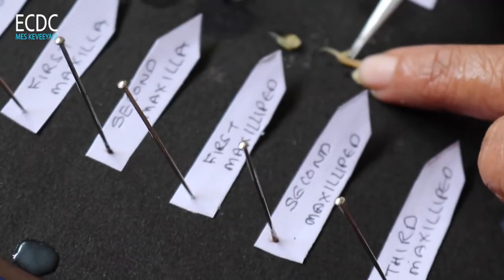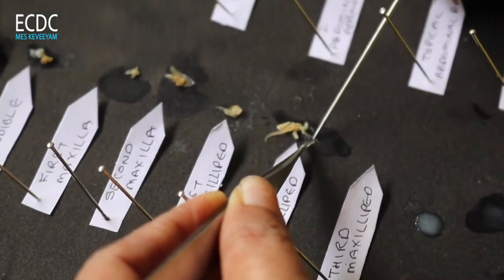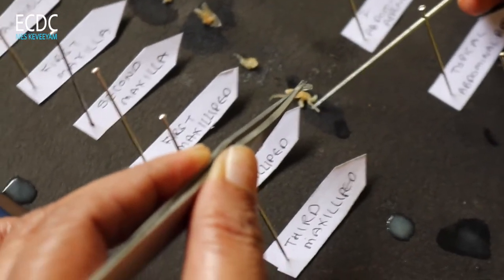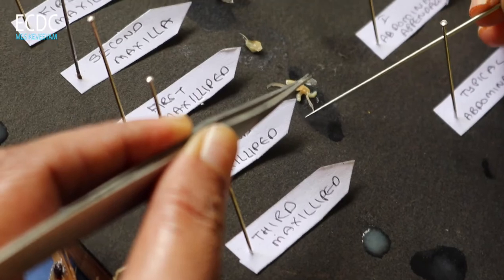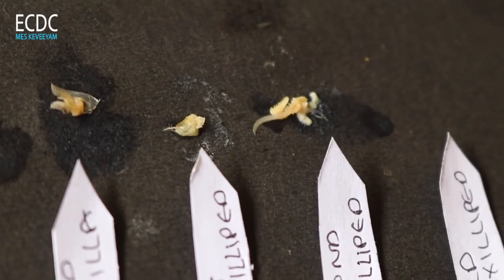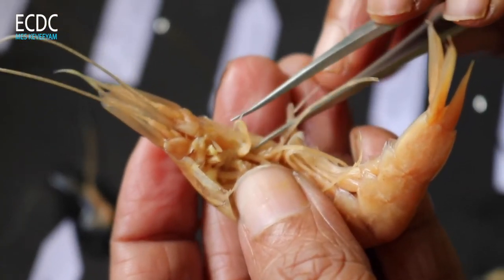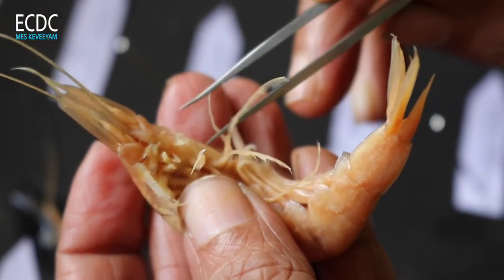There is not a question mark shape here. This is the epipodite and y-shaped accessory. This is the third maxillipedes. This side will be free to show the epipodite.